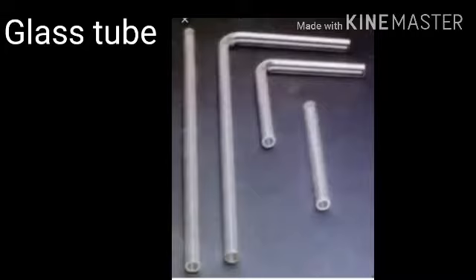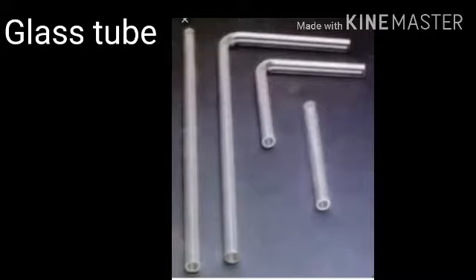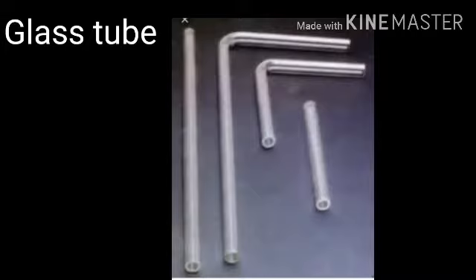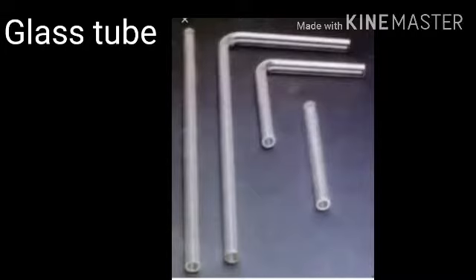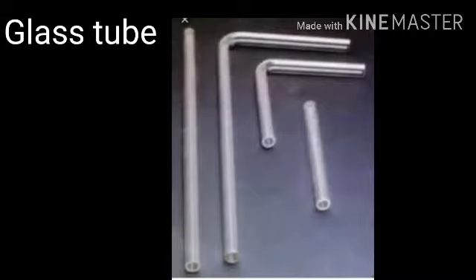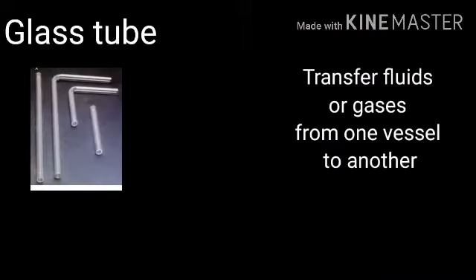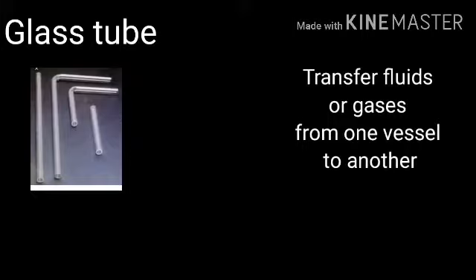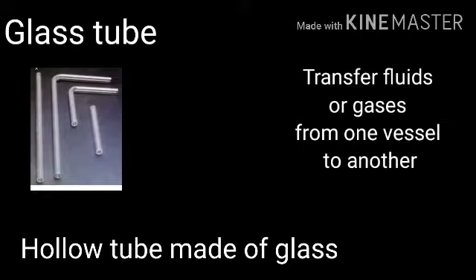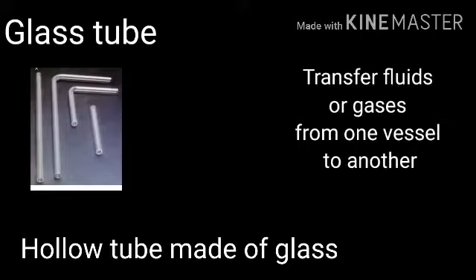Next, glass tube or delivery tube. A glass tube is a hollow tube which is used to transfer fluids or gases from one vessel to another. Through that hollow tube we can transfer fluids or gases from one vessel to another.